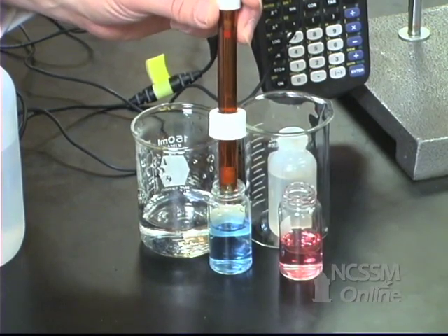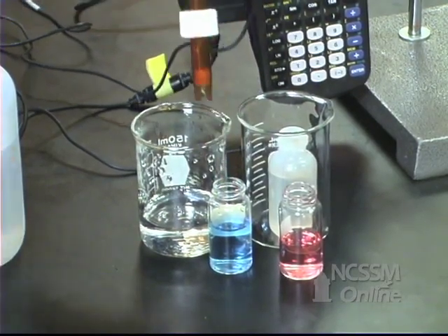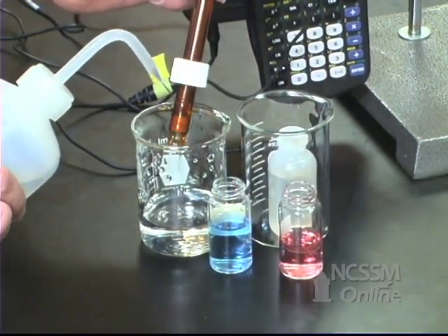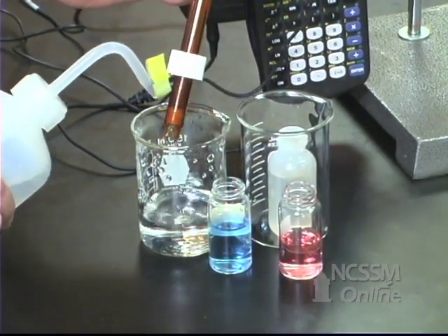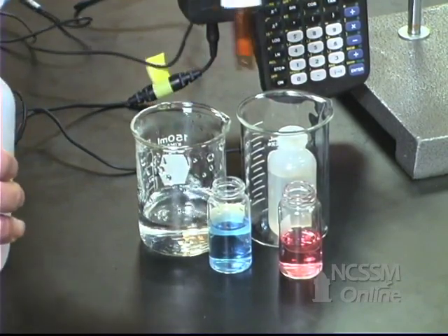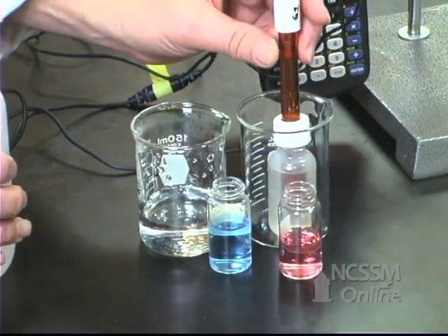We're going to take the pH probe out of the buffer, rinse it off, and put it back in the storage solution.